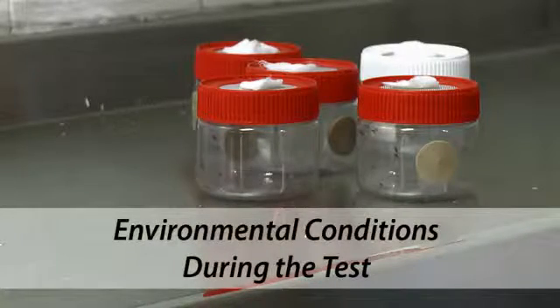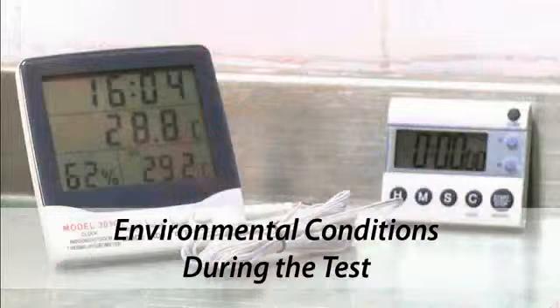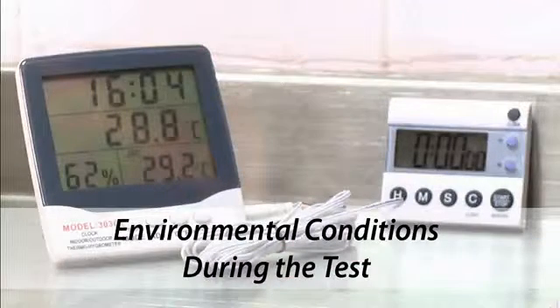The temperature at which insecticide exposure occurs should ideally be 27 degrees plus or minus 2 degrees centigrade, and relative humidity greater than 60%.